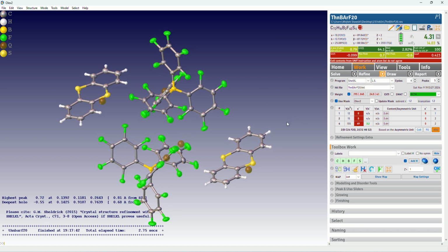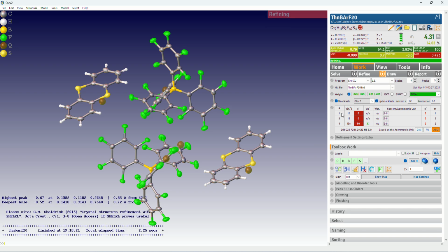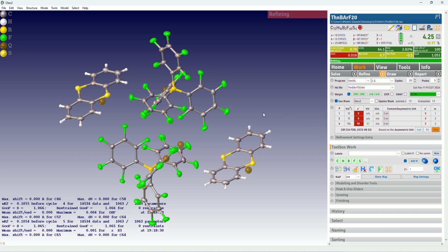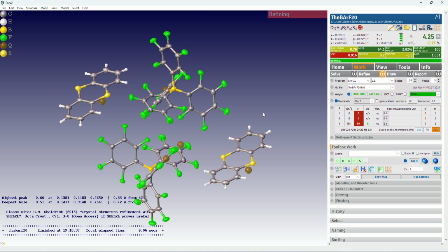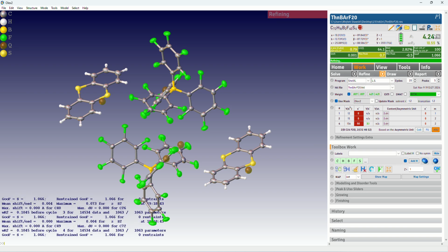It's always a good idea to update the mask before finalizing the structure. Okay, let's untick it, do extra refinements, 20, let's say. Yeah, looks good. It's still orange, so we can keep refining, but you can see that the parameters are very close to those that we managed to get without solvent masking.